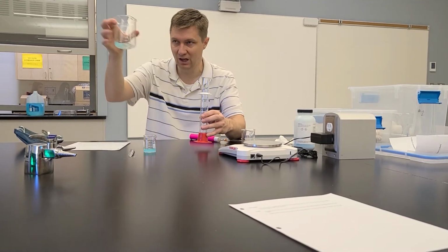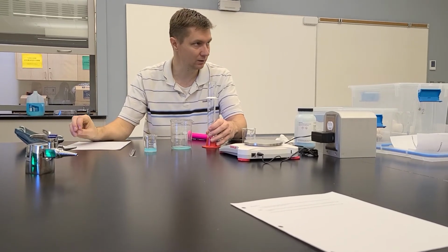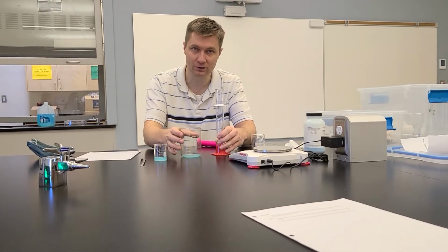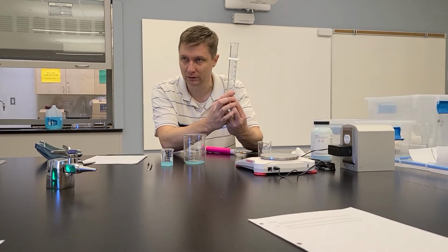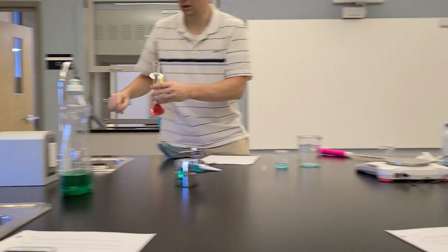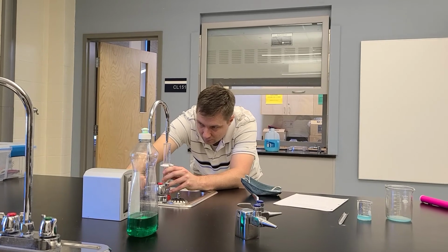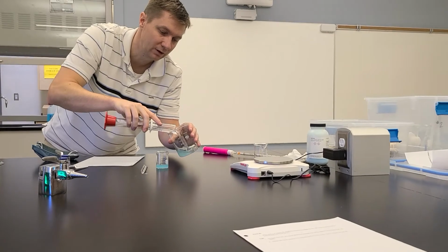So what I've got to do is, again, I know that there's 10 mils in here, and I need the diluted solution to be what volume? 150 milliliters, right? So for the 150 milliliters, I need to add in 140 milliliters of water. Does that make sense? Okay, so I'm going to go over here to the sink. I can pour in 100 mils. That little white thing is in the way. So let's say that's 100 mils, and I'm not being super exact, you guys will be.